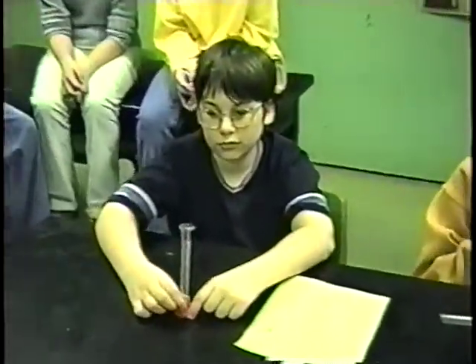Yes, okay. All right, now we're up to the liquid part. David, you've got a piece of equipment there. If you could hold that up high so everybody can see it. What do we call that piece of equipment that David is holding up? What's he got in front of him? Cylinder. What type of a cylinder? It's got a name. Not Charlie or Steve. What's its name? Graduated cylinder? Say it loud. A graduated cylinder? Yes, a graduated cylinder.